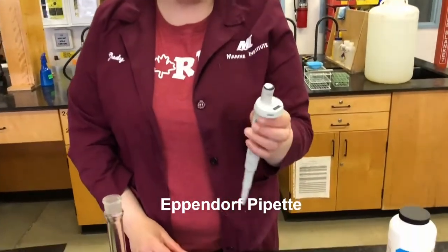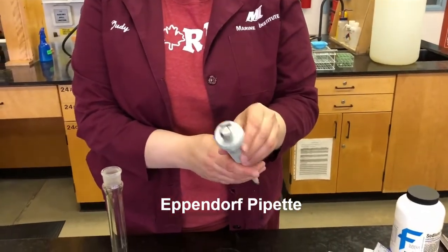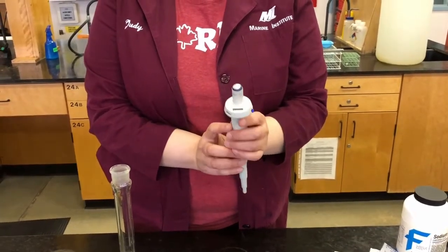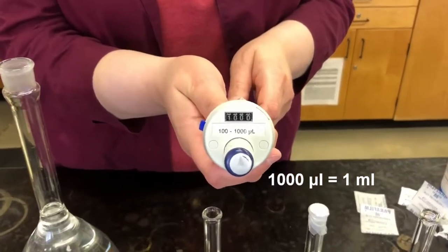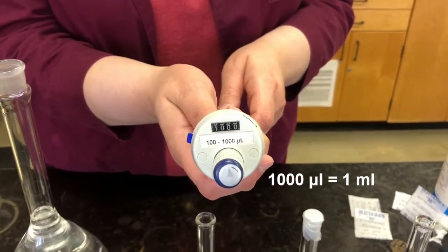Okay. So this is an Eppendorf pipette. Just to familiarize you with how these work, this is a 1,000 microliter pipette. So 1 milliliter is 1,000, if you can see that, is 1,000 microliters. Okay. So this pipette is set to 1,000 microliters, which is 1 milliliter.